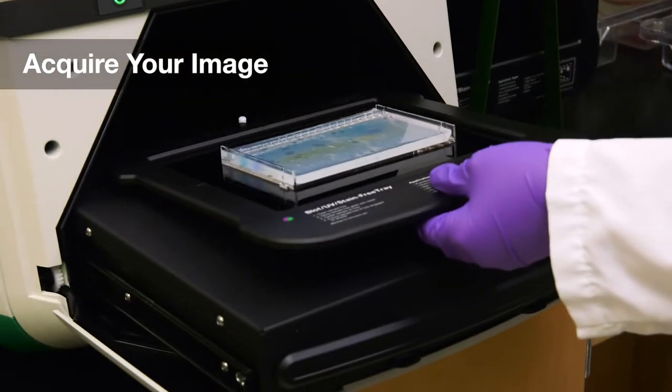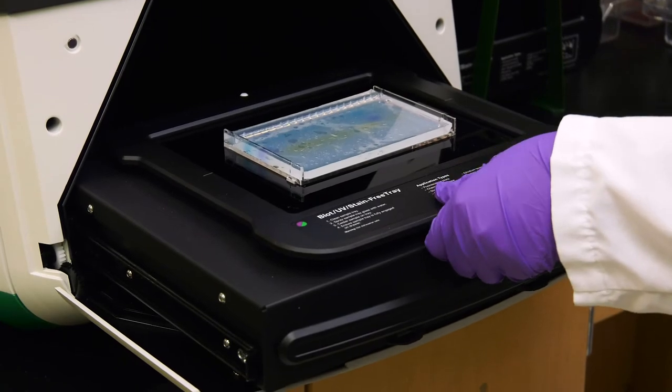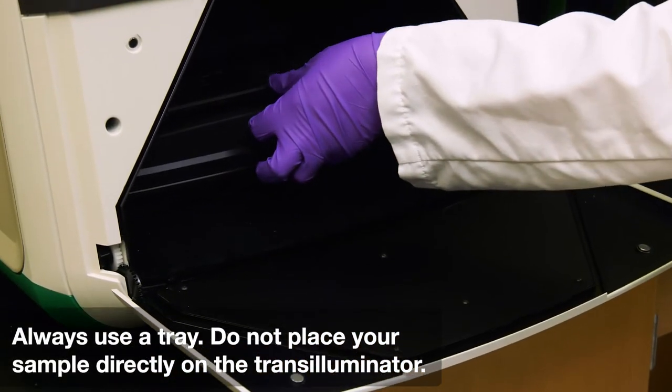Once you are satisfied with the position, push the transilluminator back in and close the drawer.